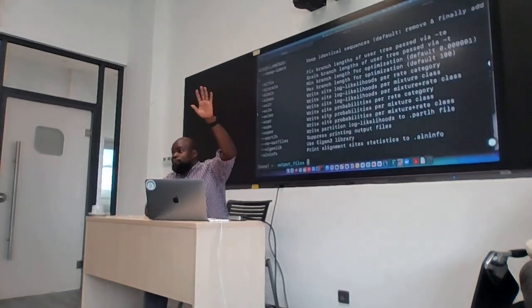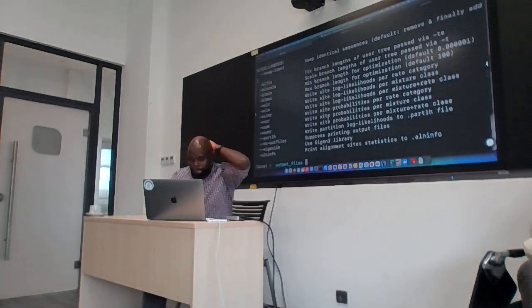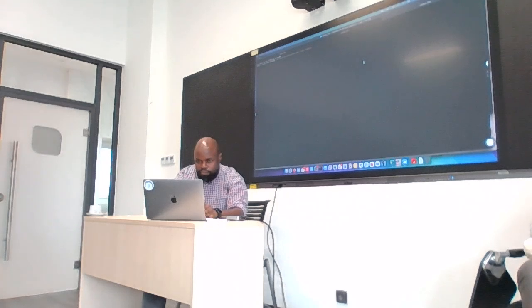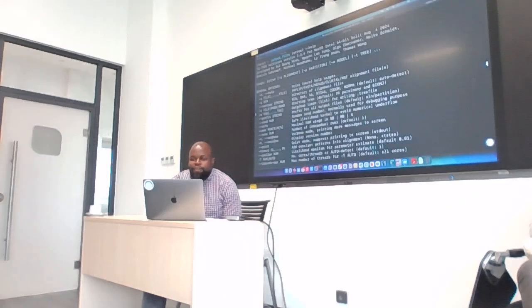IQ-TREE, and then they developed IQ-TREE 2, which should be much faster and more accurate. But I don't know whether nowadays both of them do the same thing. But I prefer to run IQ-TREE 2. Okay. So this is now just clean. If I do iqtree2 help, you can see that it has very many options. Okay? Very many.